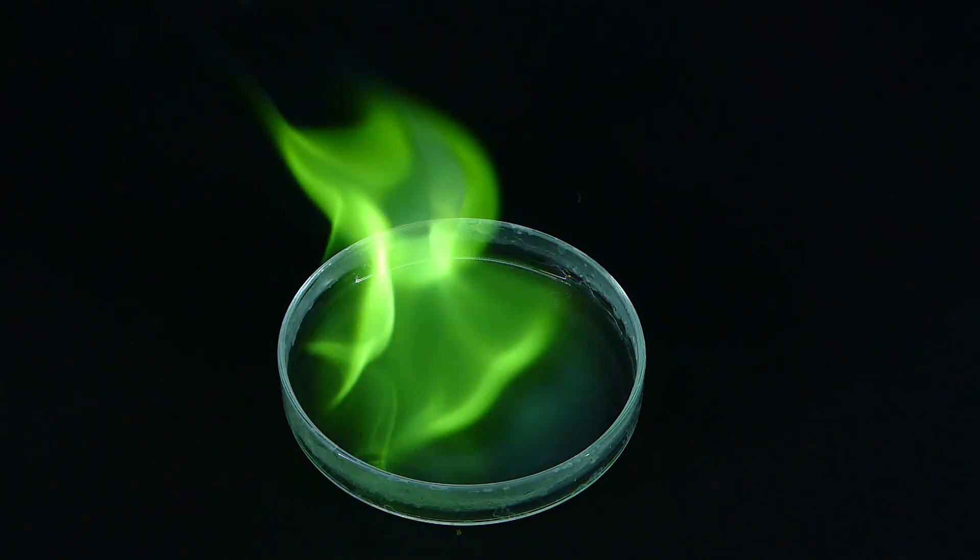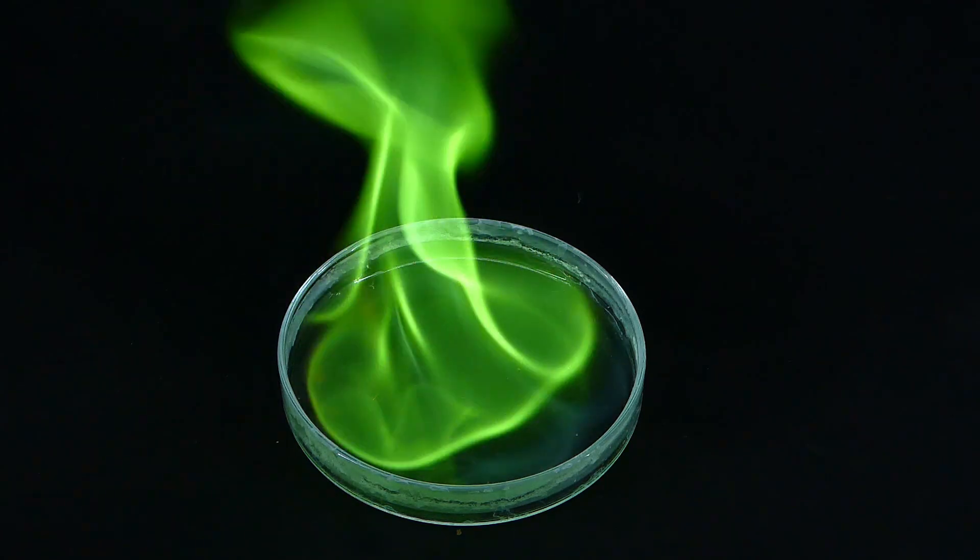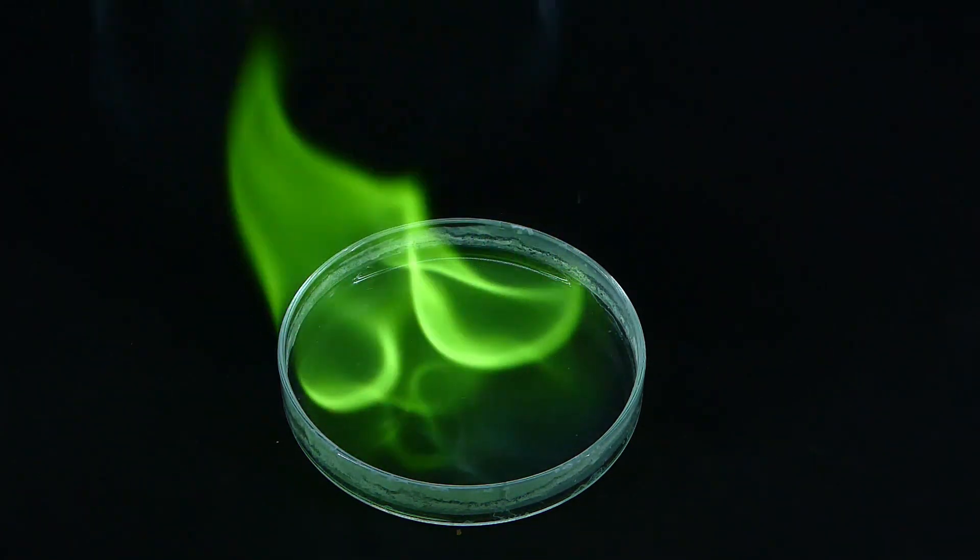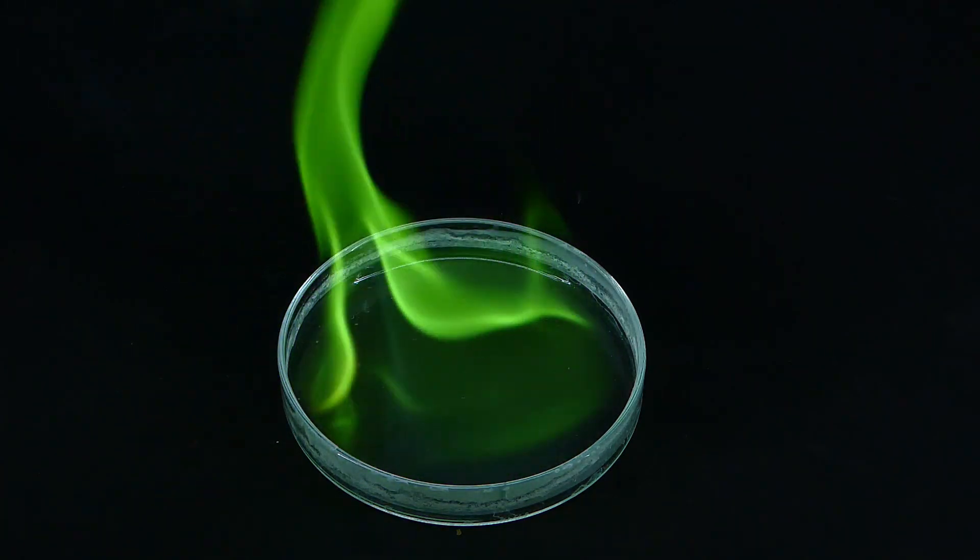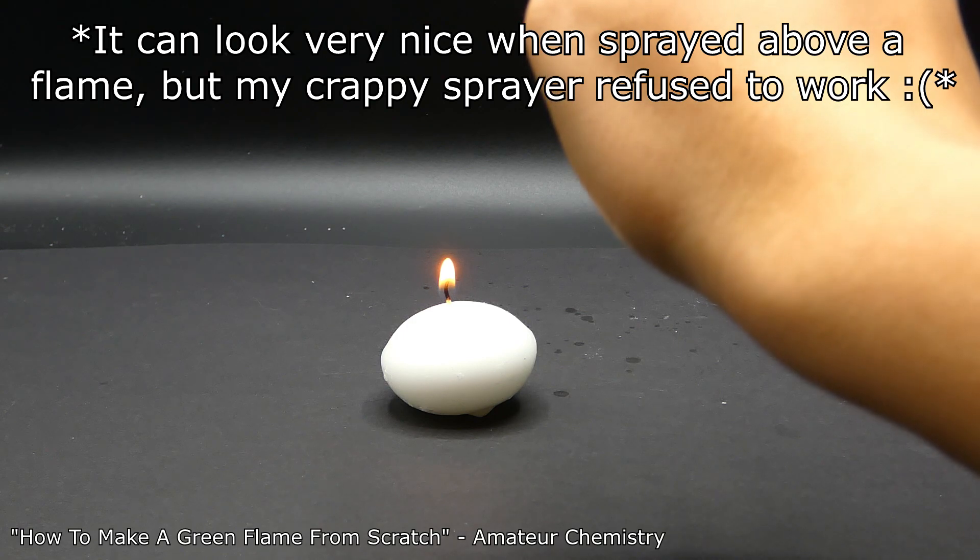After all of that, you would probably think that I have some kind of chemical use for my product, but no. As a chemist, I did this whole reaction just to play with the product. That's why I love chemistry. Anyway, I wanted to repeat a failed experiment from the first video in which I wanted to make a green fireball using a sprayer and a candle.